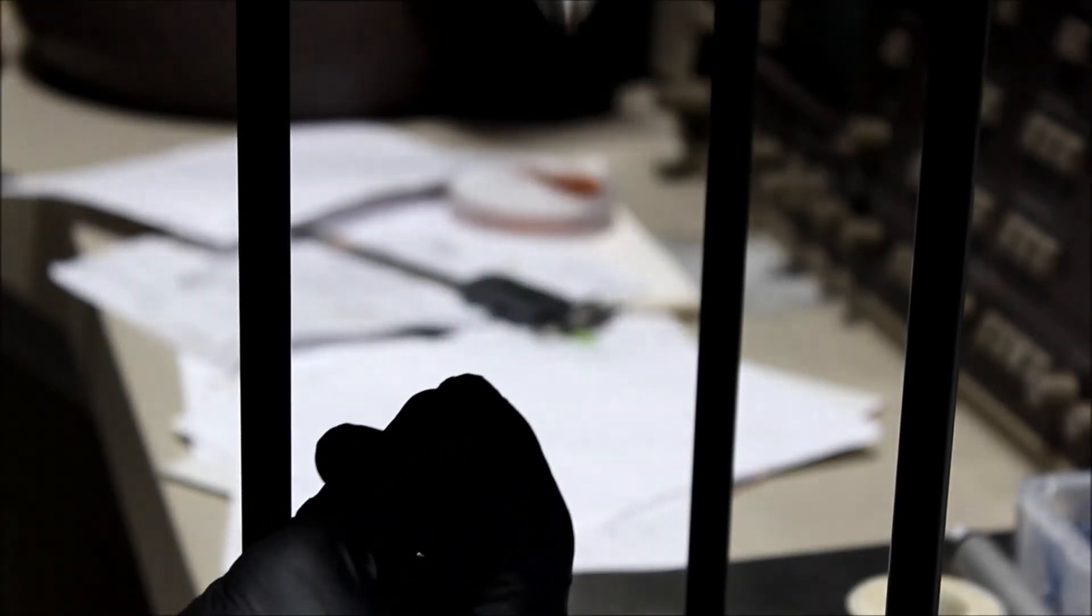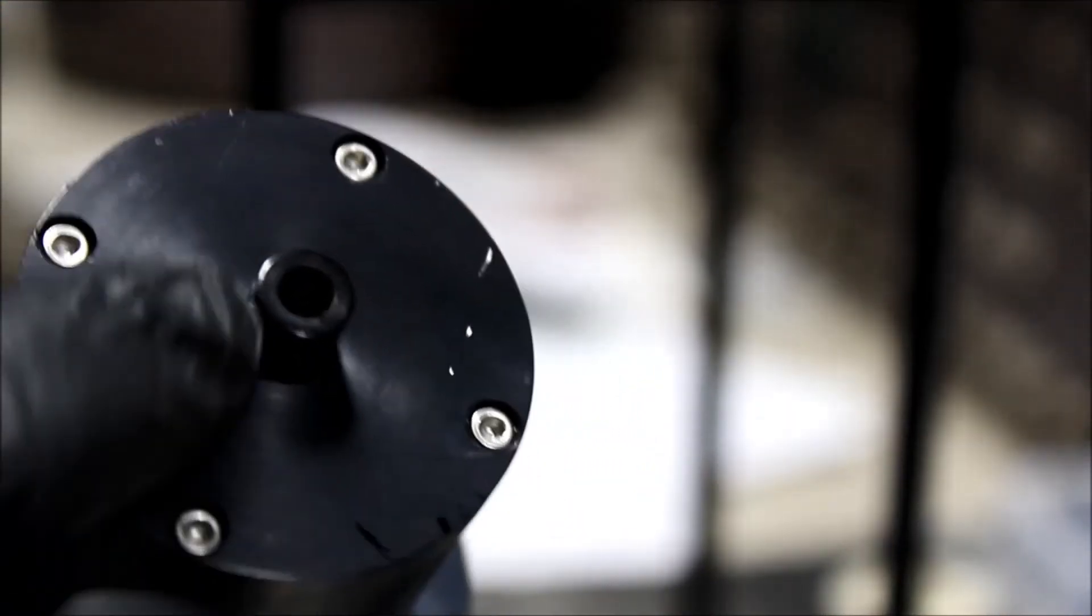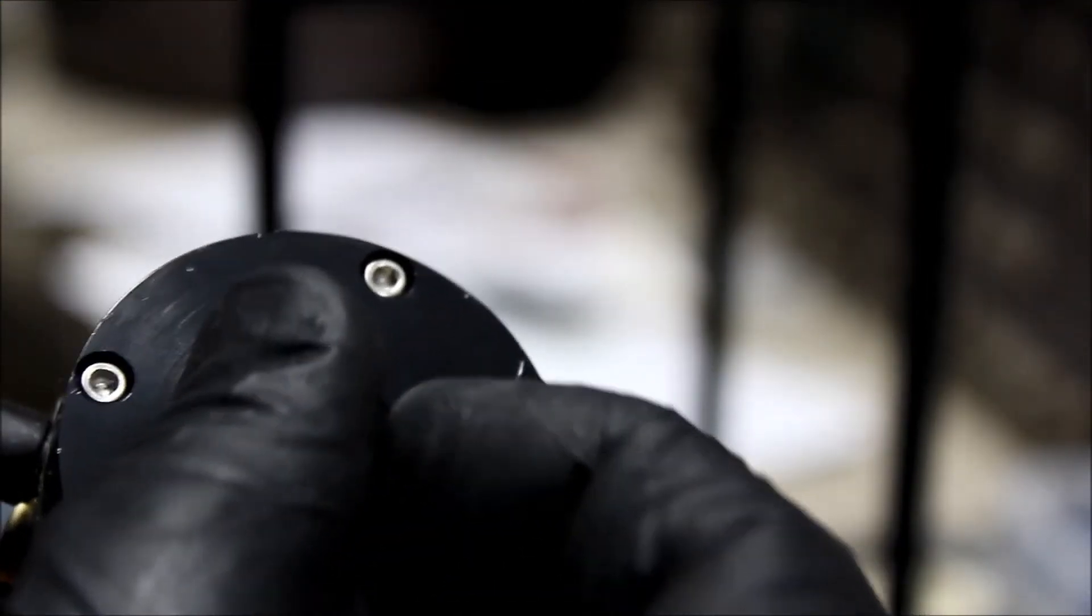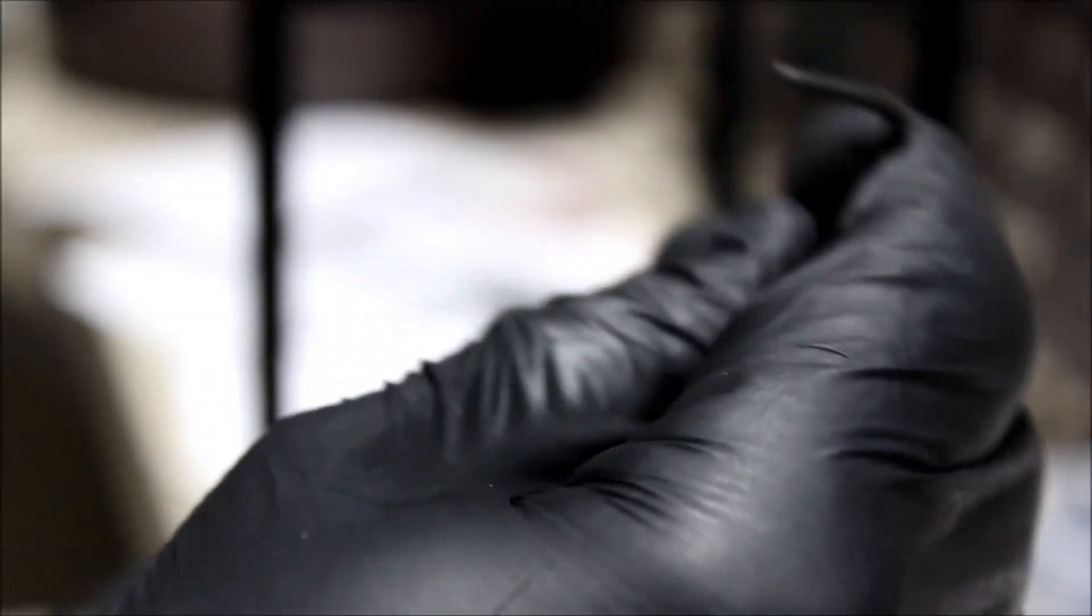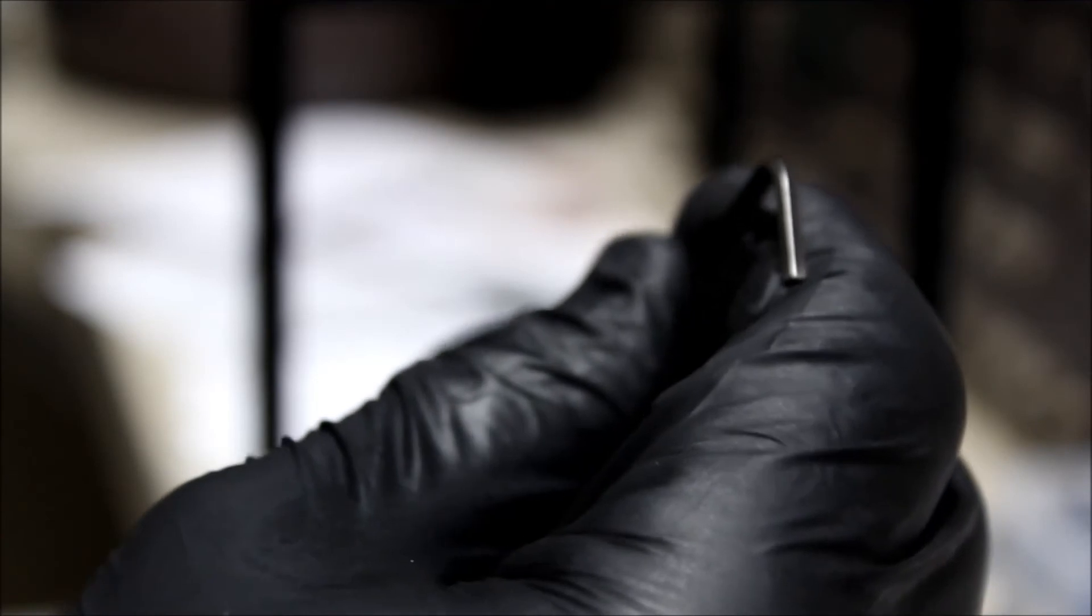Now we can go back to our thumb screw here and we can turn it counterclockwise, turn it counterclockwise until we feel the valve seat, when the pressure kind of releases on the turning of the screw. And now we can tighten up the set screw in the middle. And now the valve position is set.